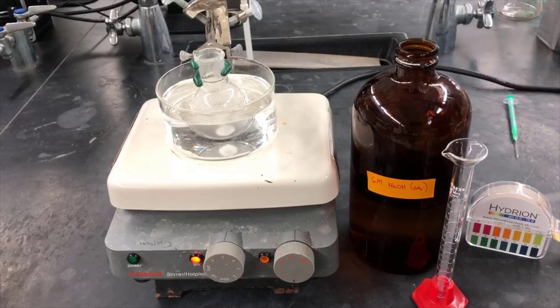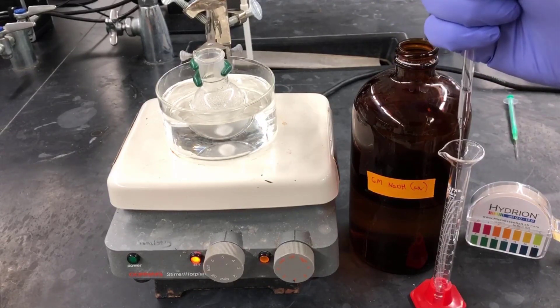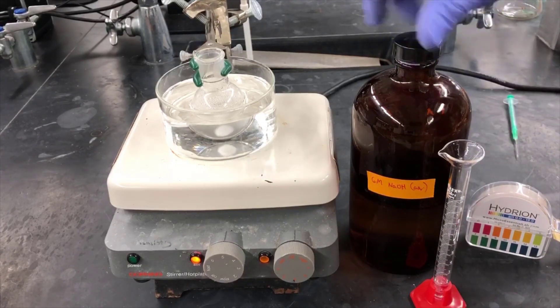In the next step of the workup, we'll be adding 6 molar NaOH, sodium hydroxide. This is a strong base.